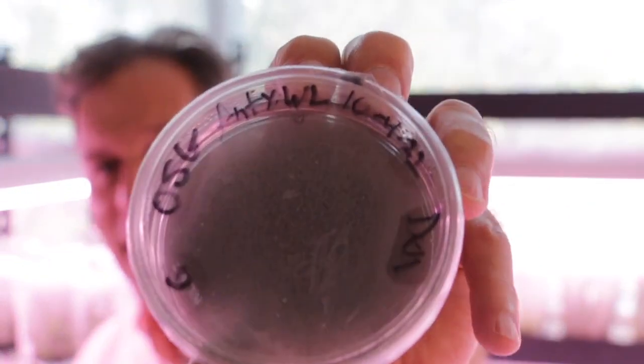This is another one of mine. I'm sorry, and it's going to get a little bit better, but not much. This is another one of mine, and this is a Dendrobium cross. This is an interspecific cross with Dendrobiums. And there was a lot of seed.